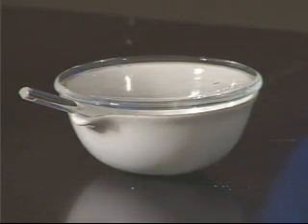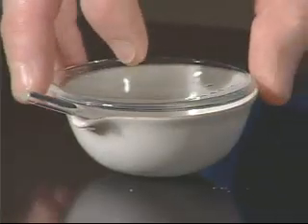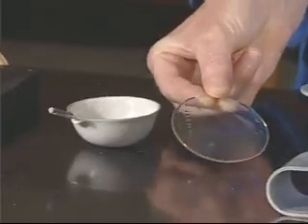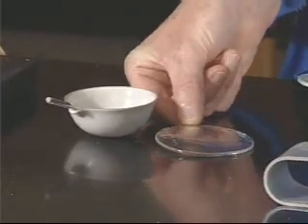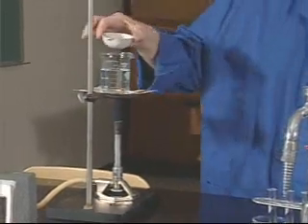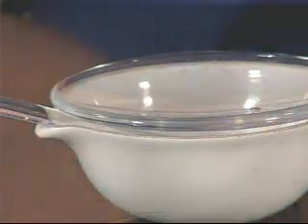The next thing that you need to do is to put the evaporating dish on the beaker that's making the hot water bath. Before you do that, you need to remove the watch glass from the evaporating dish, and you can leave the watch glass off for the first part of heating so that evaporation takes place a little bit more quickly. Occasionally you also want to stir to break up any crust that might form. As heating progresses, you may find that the solution begins to splatter, and at that point you will need to put the watch glass back on the evaporating dish for the end of heating.